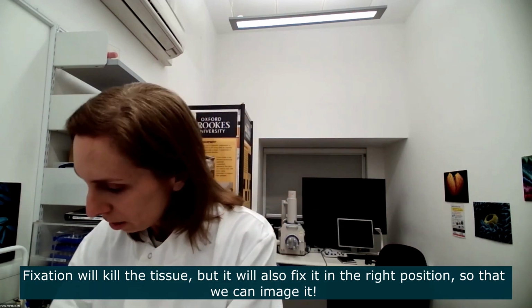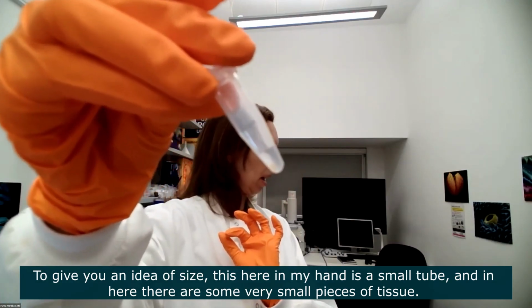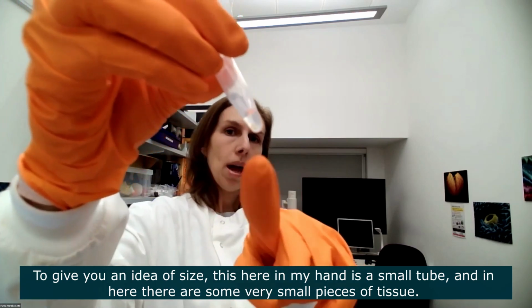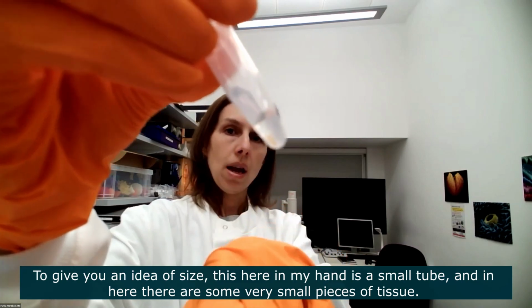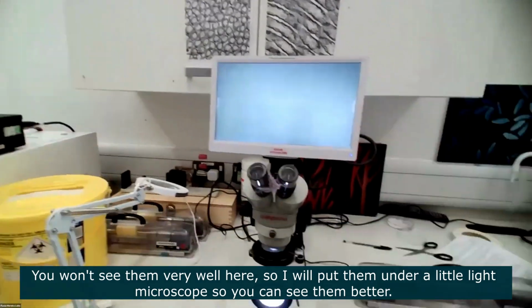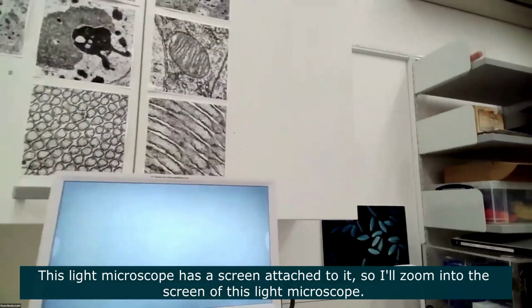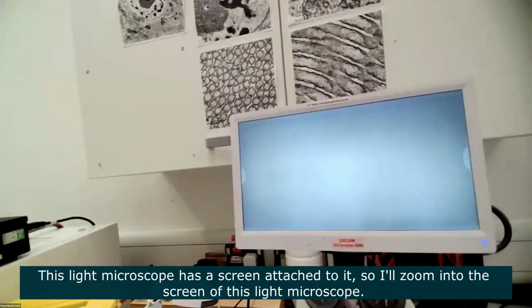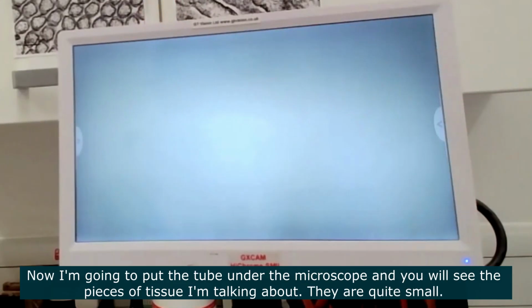To give you an idea of size, this here in my hand, can you see this is a tube? This is a very small tube, and in here there are some very small pieces of tissue. You won't see them here very well. I'm going to put them under the microscope. So we have another microscope here. That's a little light microscope, and it has a screen attached to it. So let's put the screen. Yeah, there you go. So now I'm going to put this tube under the microscope, and you will see the pieces of tissue that I'm talking about. They are quite small.